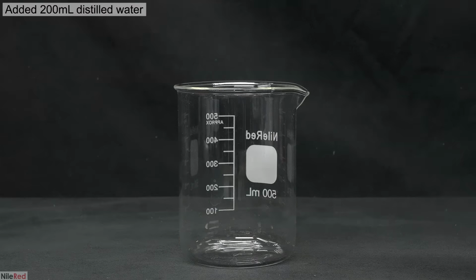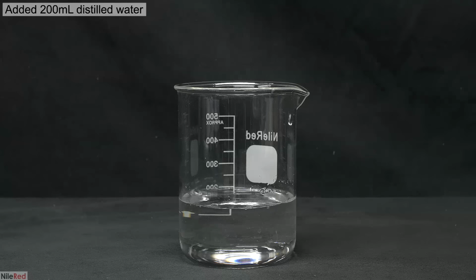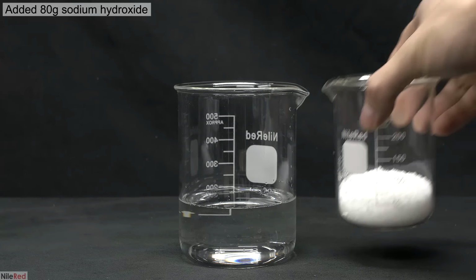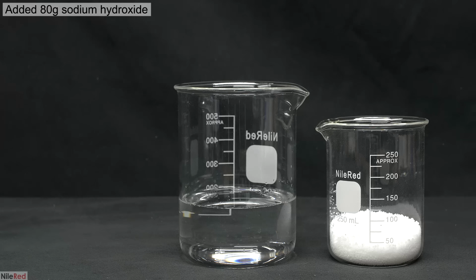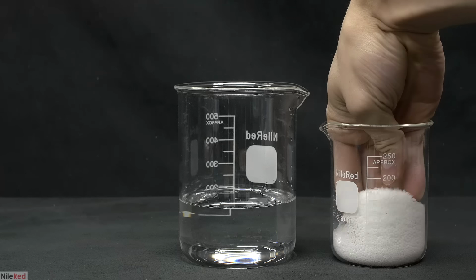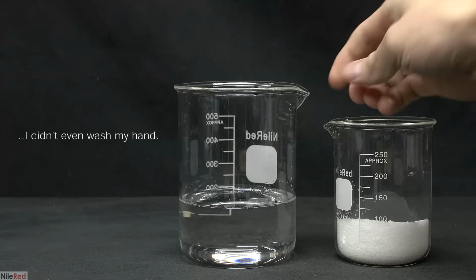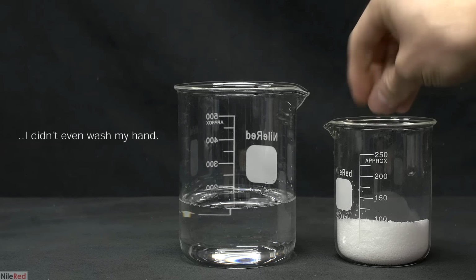To start things off, I need to make a sodium hydroxide solution, so I measure out 200 milliliters of distilled water. I then weighed out about 80 grams of sodium hydroxide. Sodium hydroxide is a strong base, so you should be careful when working with it. However, unlike what they showed in Fight Club, touching it isn't going to melt your skin. If you get it on your skin or hand, just quickly remove it and, for good measure, wash it with a bunch of water.